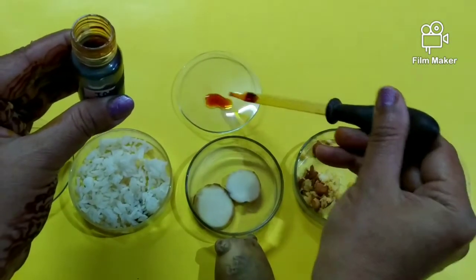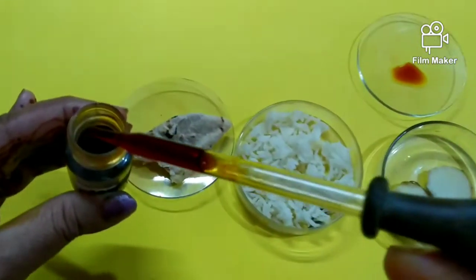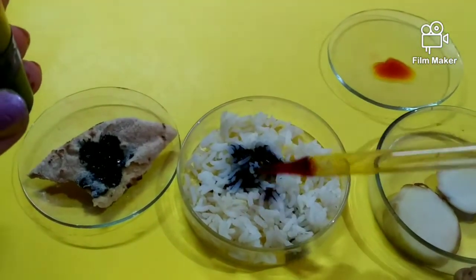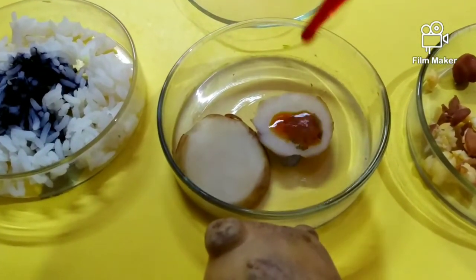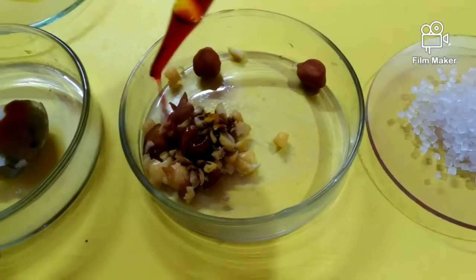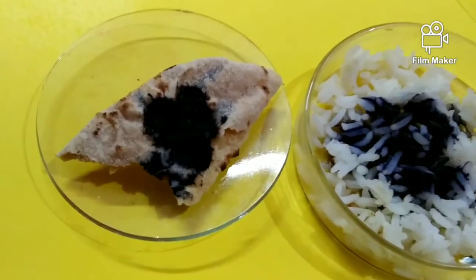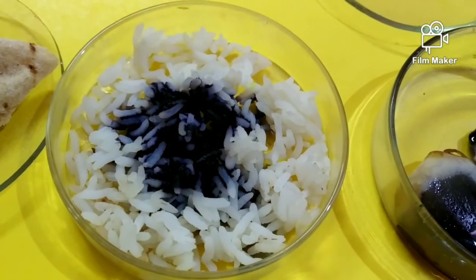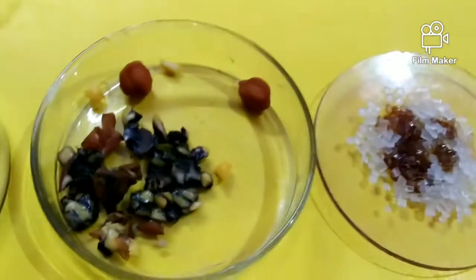Now we will pour some drops over the samples one by one and observe the change in color. In the rice and in the chapati, the color has changed — it has turned blackish blue. The same change is seen in the potato as well.